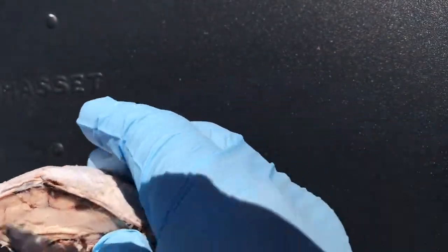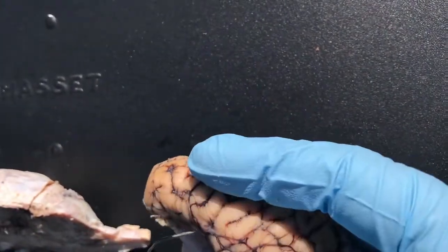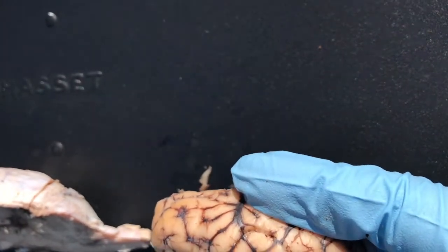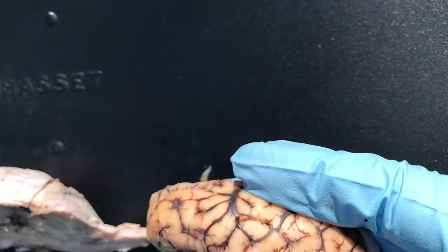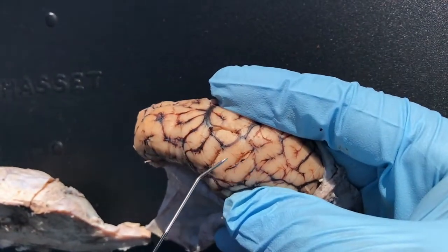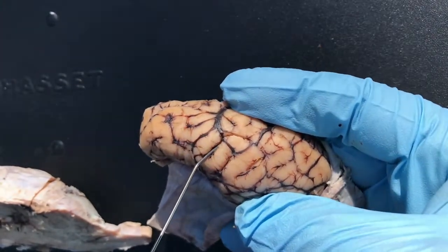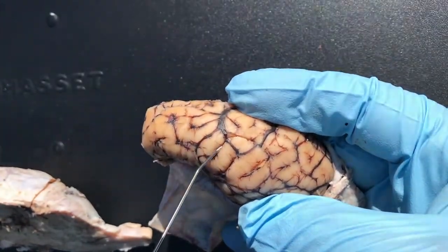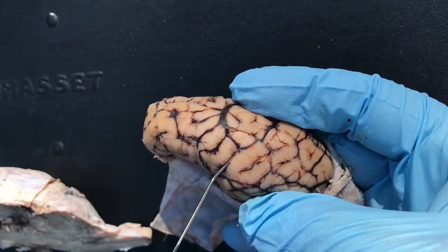Also, let's switch here and take a look over here. We have these little bumps — we'll just make little incisions here so you can see. These little bumps, these little hills, these mountains — these are called gyri. Or one is called a gyrus. So this is one bump here, here's another one — this is called a gyrus. And the indentations, the little valleys, are called sulci. One is called a sulcus. So: gyrus and sulcus.